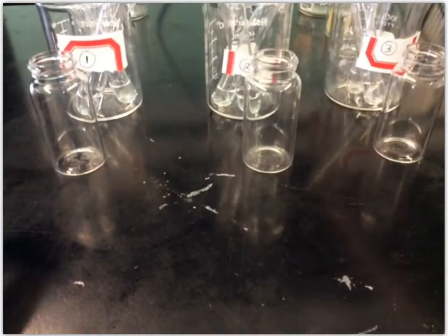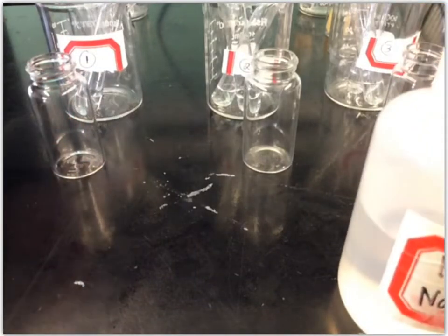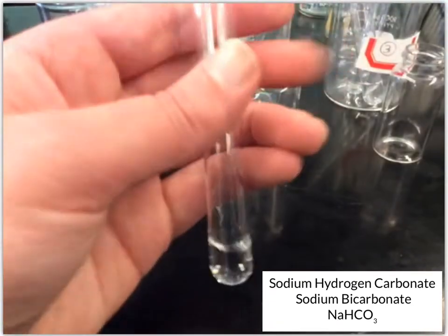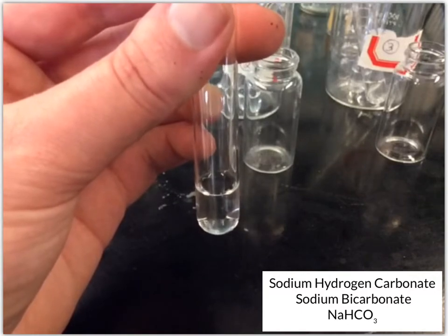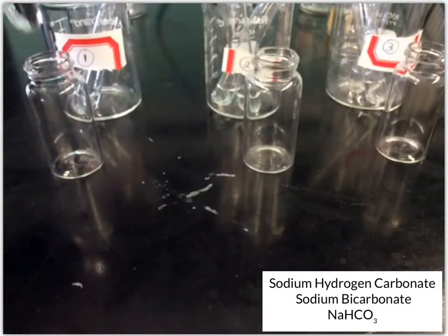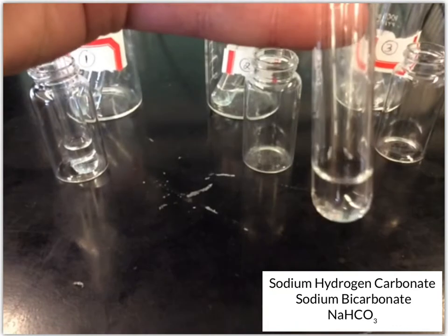Then next, we will do the test with sodium hydrogen carbonate, or sodium bicarbonate. And unknown 1 with sodium bicarbonate. That one looks like no change. Unknown number 2 with sodium bicarbonate.